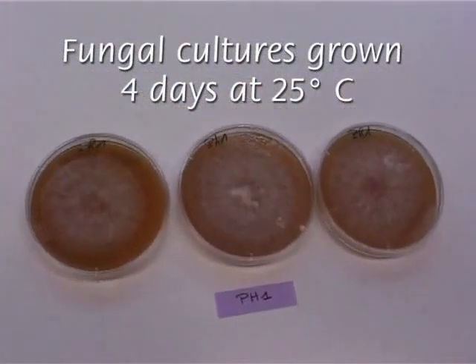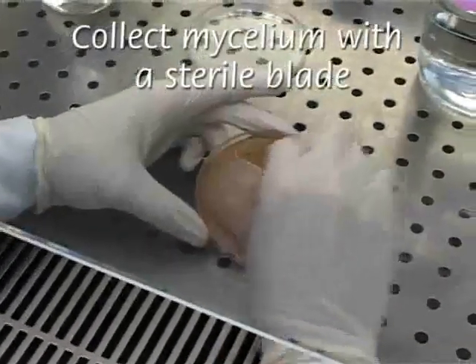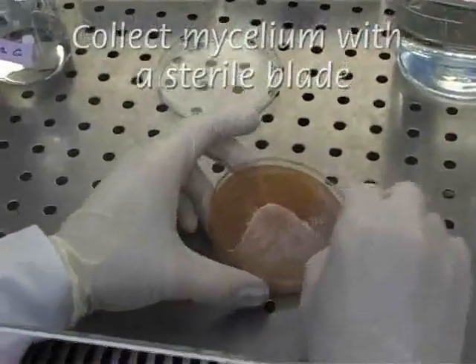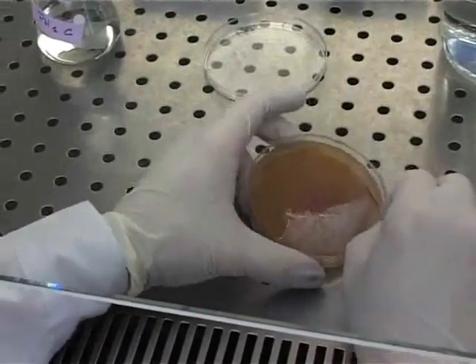After 4 days, colonies are still actively growing toward the edge of the plate. Typical aerial mycelium is formed and is collected using a sterile blade under a laminar flow box by gently scratching the surface of the plate.